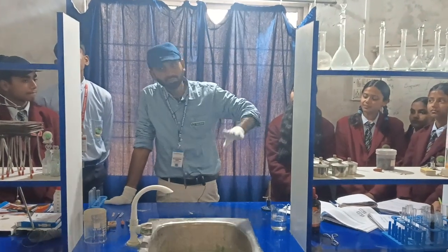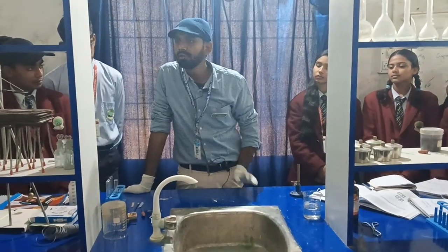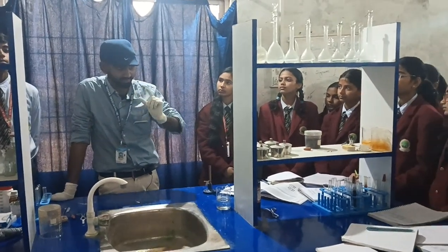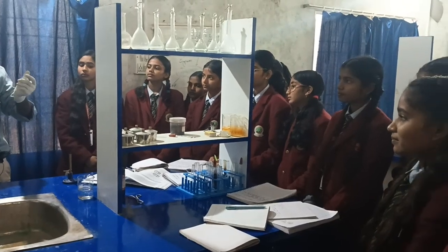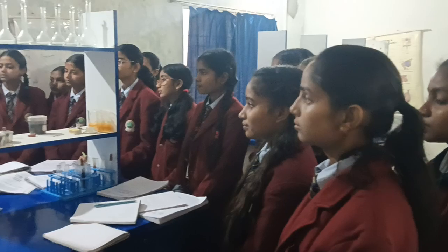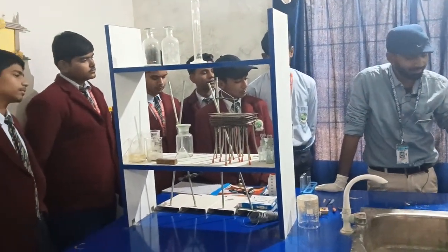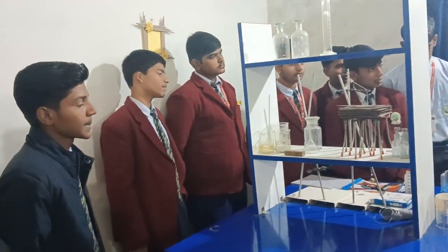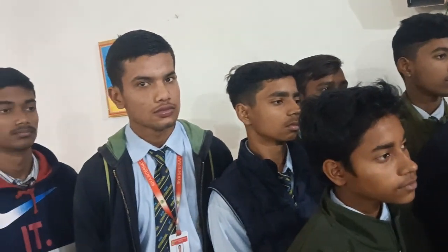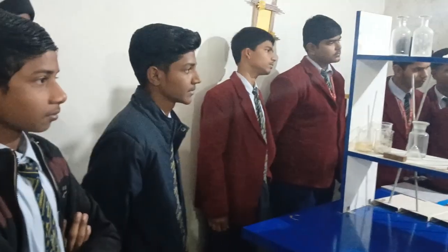To summarize our first experiment: when magnesium reacts with oxygen it forms magnesium oxide. Because the reaction rate is very fast when heat is applied, it is called combustion. It produces a dazzling white light, and the white ash is magnesium oxide. When the ash is dissolved in water it forms magnesium hydroxide, which is of basic nature. This confirms it is a chemical reaction — a new substance with different properties is formed — and it is a combustion reaction as well as a vigorous reaction.